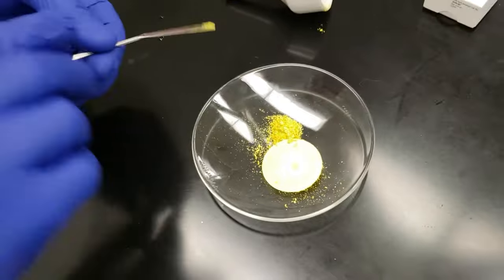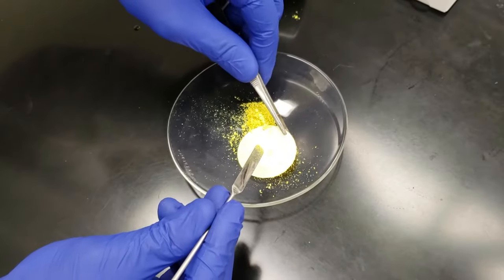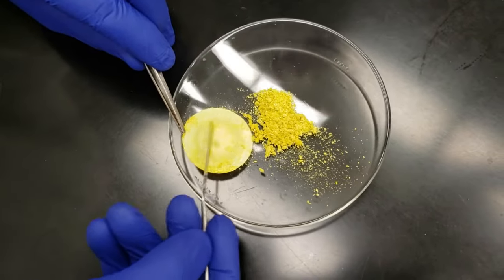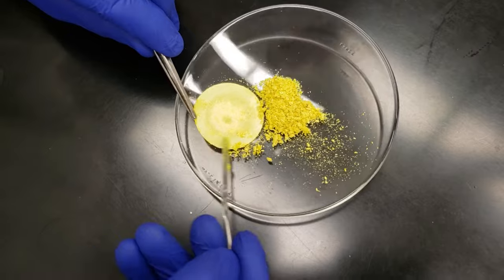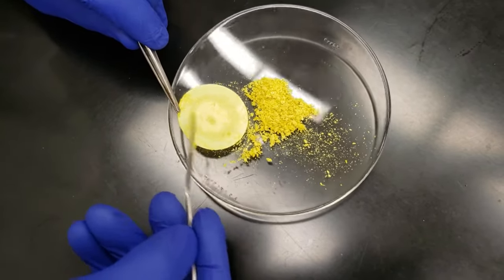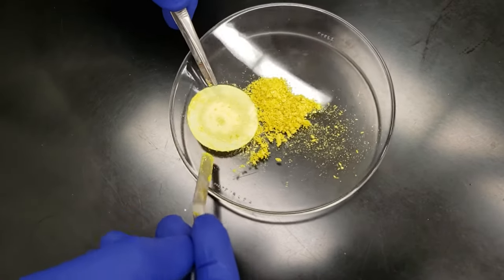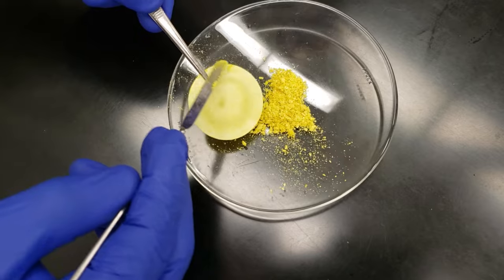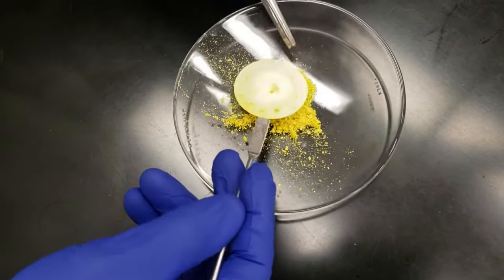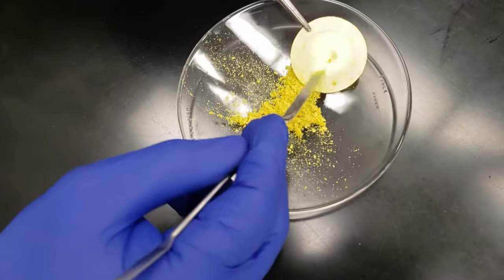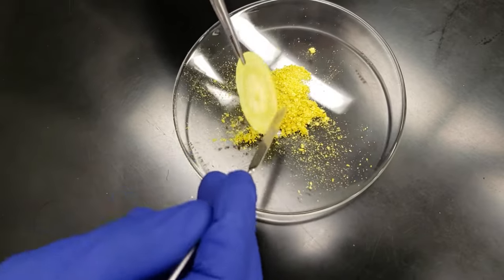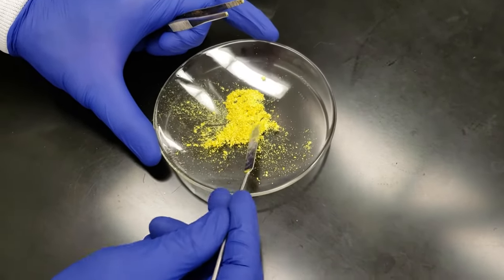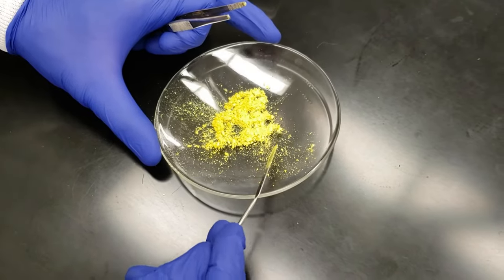So now I'm going to pick up my filter paper, hold it by the edge, and I'm just going to scrape it down to make sure I get anything that's still stuck to the paper. And there's actually quite a bit. We'll look at the back side as well. And there we go. That's just about everything that we can get. So we'll go ahead and put this in the oven for about five minutes, let it dry out even more, and then it'll be time to weigh it and to get a melting point.